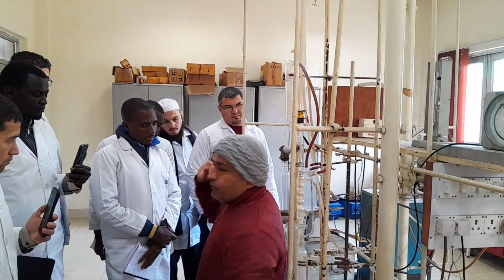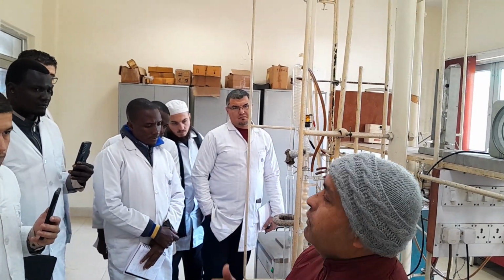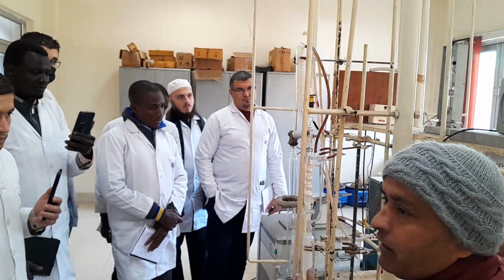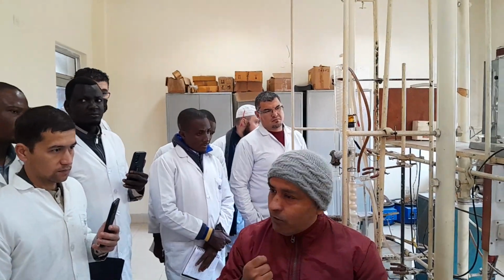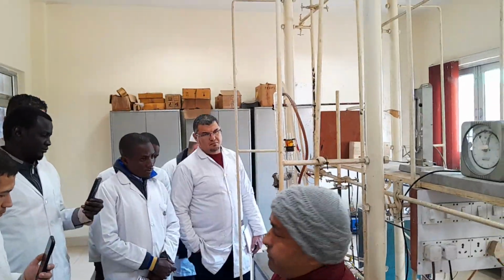Okay, so initially we have taken the weight of the crude oil. After removal of the C1 to C4, let it come to room temperature, then you can weigh it again. So there will obviously be a loss. That loss has been captured inside this plastic balloon. This balloon goes directly to the GC lab, and the GC lab will directly inject the C1 to C4, and there you will find the whole composition of the LPG potential or debutanization of the crude oil.